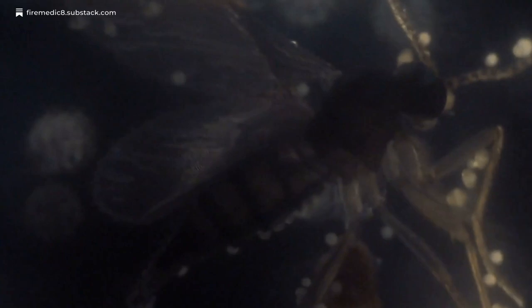Okay, as you see, I set a little petri dish out, a little bit of distilled water in there, and all I did was allow nature to collect itself in there, or so-called nature, right? So I want you to pay close attention to these little gnats. I believe they're gnats. And we're just going to take a little scroll through some of these initial clips.